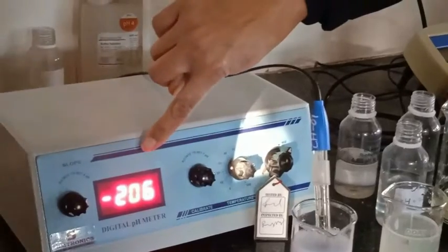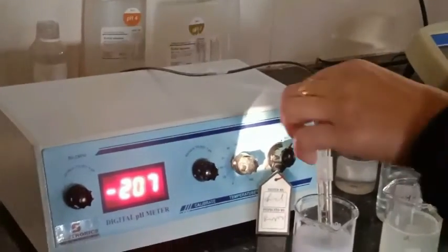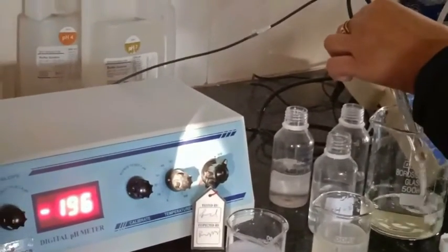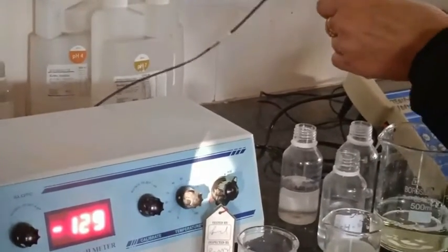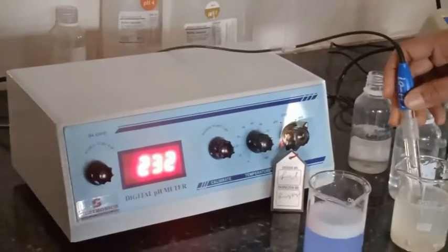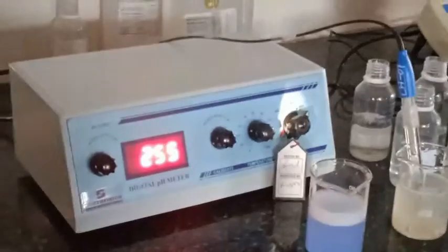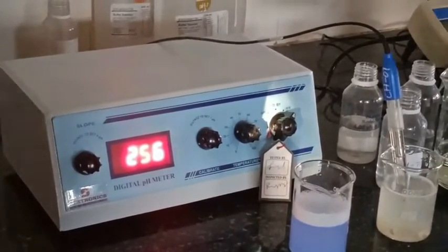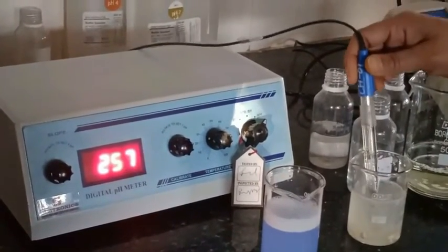When looking at the potential readings, the value is negative for basic solutions. As you know, for every pH unit the potential changes by 59 millivolts. For an acidic solution the millivolt reading is positive. This is how the combined electrode works.